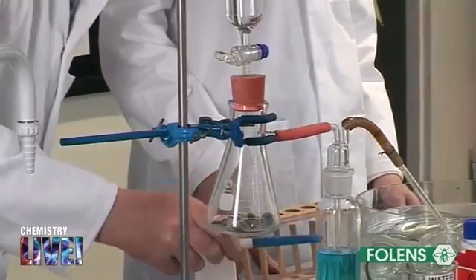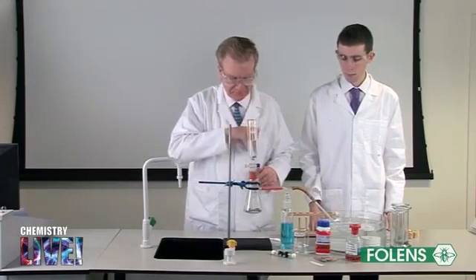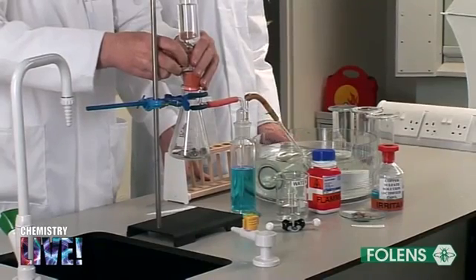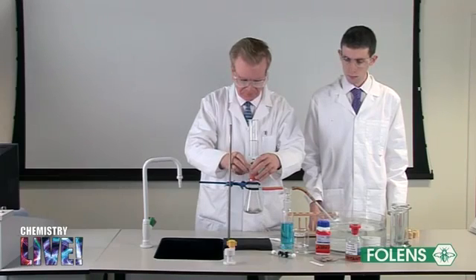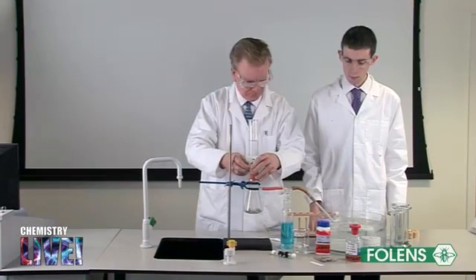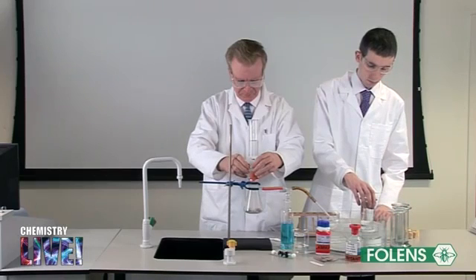Double-check that you have connected the gas washing bottle correctly. Using the dropping funnel, add water slowly to the calcium carbide to maintain an even, not too vigorous, evolution of gas. Collect some test tubes and a few gas jars of the gas.